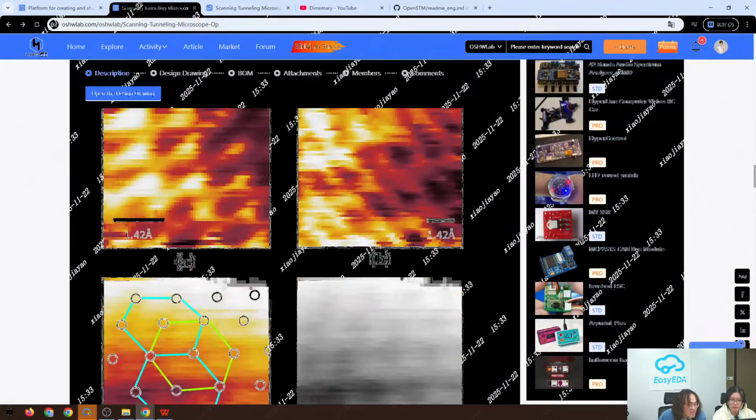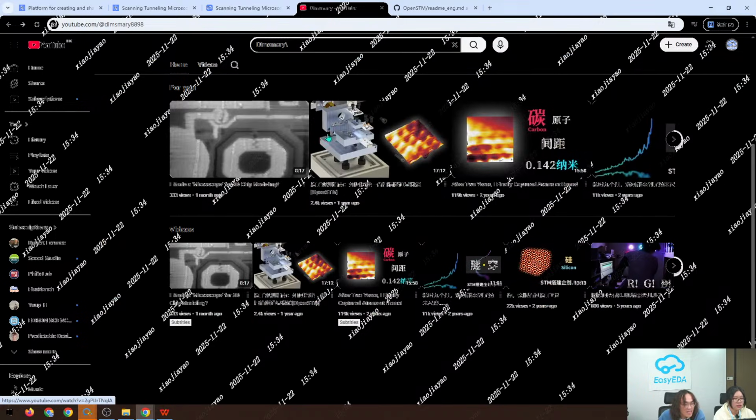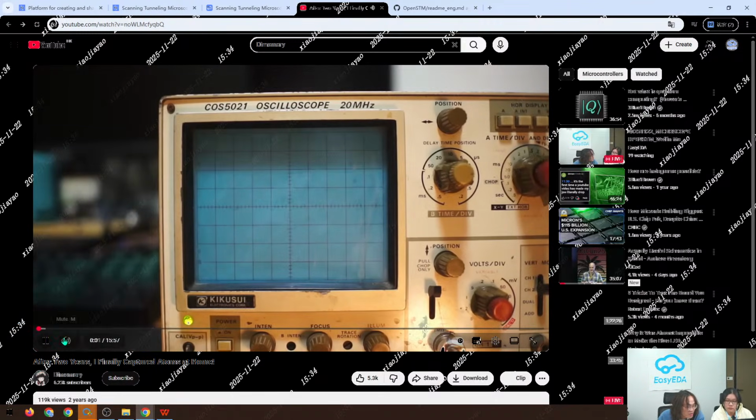Yeah, and as we can see, every spot here, we can recognize them as atoms. The distance between each atom we might regard as 1 or 2 angstrom, in which 1 angstrom is about 0.1 nanometers. So this is the so-called scanning tunneling microscope. This is my YouTube channel, and you can search Dimsmary, and you can get into my YouTube channel. And this video illustrates all the details about my scanning tunneling microscope.